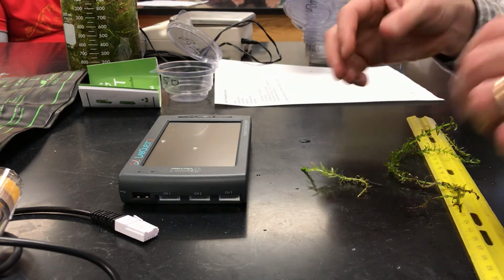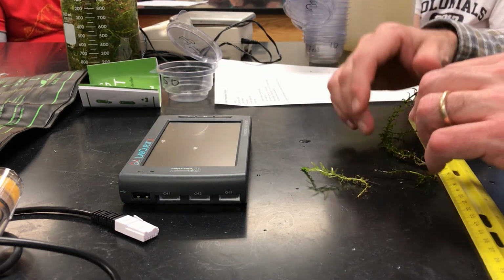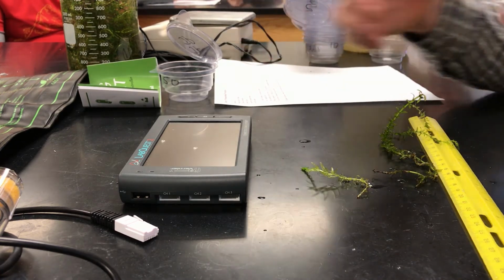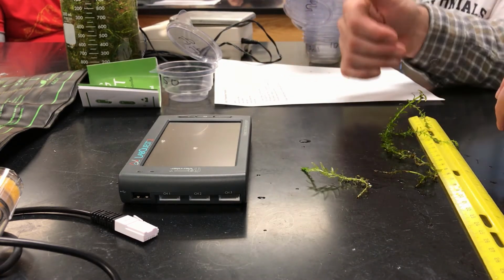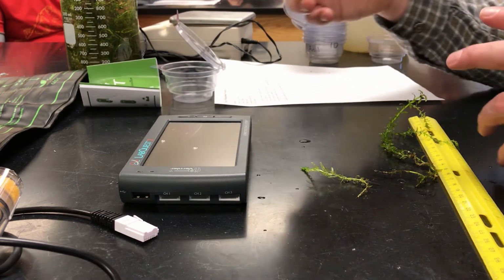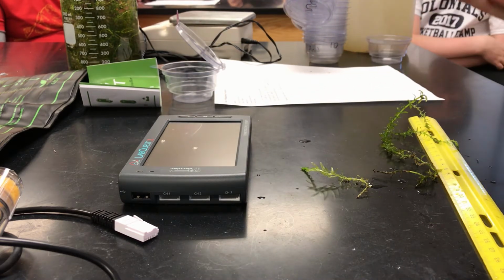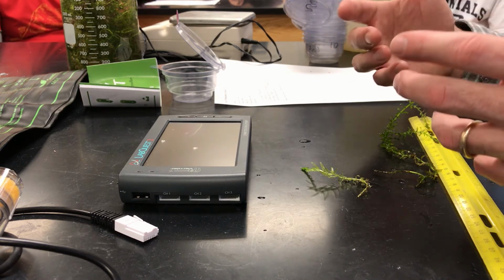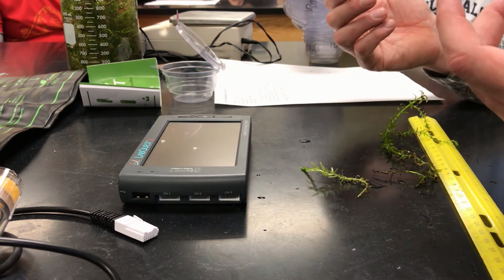But one of those two should be a standardizing way. So you should know in cup 1, my plant has these characteristics, either this length or this mass. In cup 2, my plant has this length or this mass. And that way, when you get your oxygen rates for each of them, you can divide by that standardizer. Does that make sense? Okay.